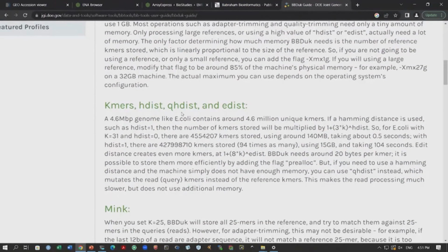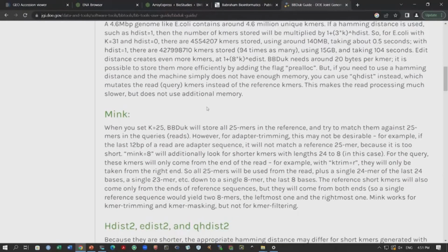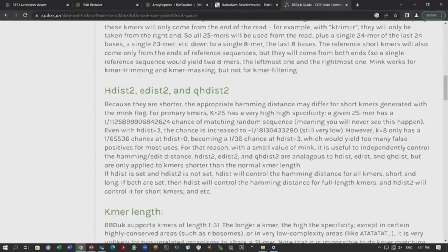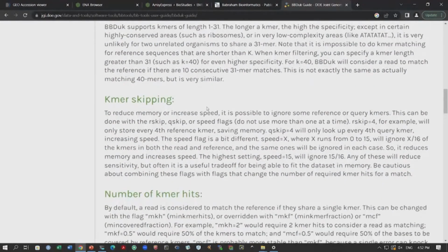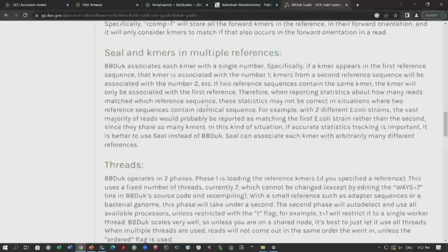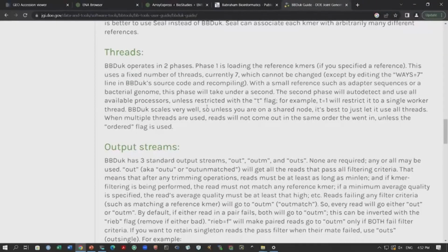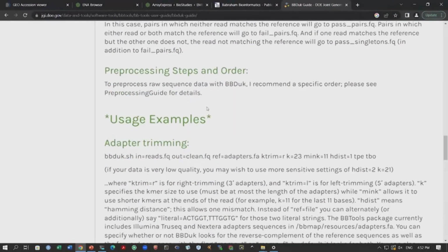Again, without going into the algorithm, these parameters are part of the tool, and sometimes you need to assign certain values for getting the best results. And this is something that you have to do by trial and error. You have to optimize these parameter values through trial and error. You set a certain value and see whether the trimming has occurred properly or not. If it has not happened, you go back and modify the parameters and try again. So, there are some parameters that work pretty well, you can probably find out once you have tried this out.